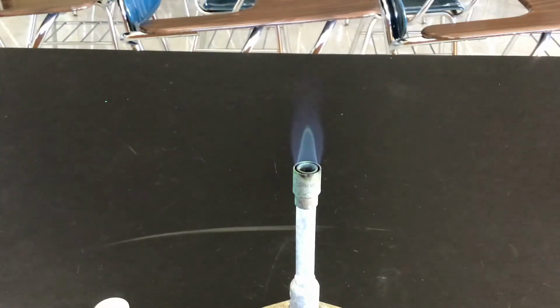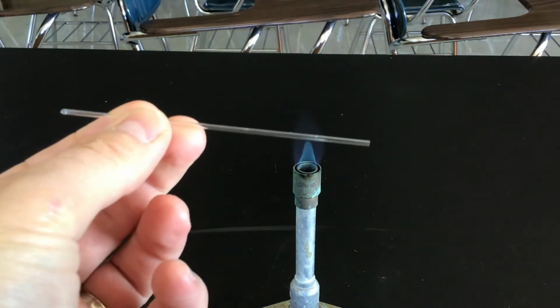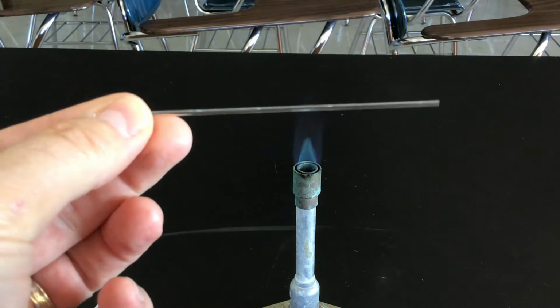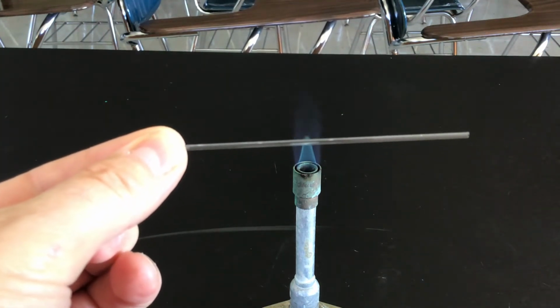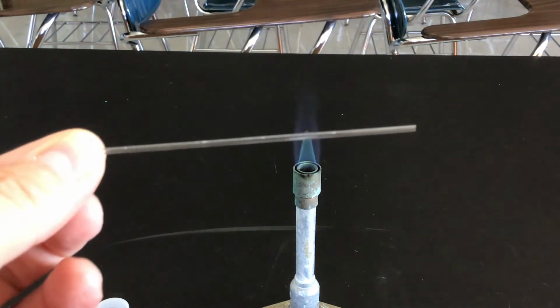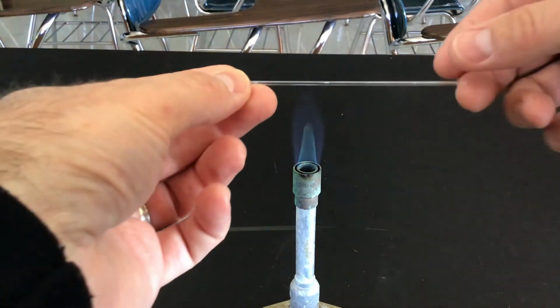All right, so I've got my Bunsen burner lit. I've got a small flame that's blue, nice and hot, with an inner cone there. We want a small but hot flame for this. We've got our melting point tubes. In lab, you would hold this on either end and put it in the middle of the flame. It's going to heat up really quickly, and then we're going to pull these straight out. Hopefully I can do this without knocking over my iPad. Let's give it a try.